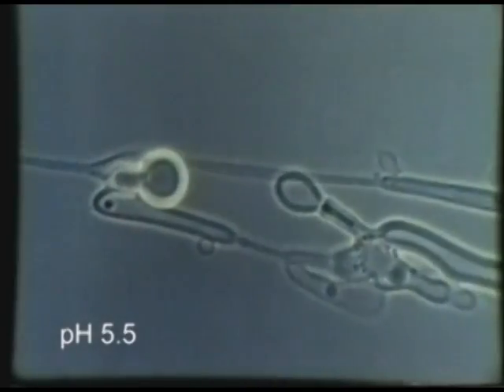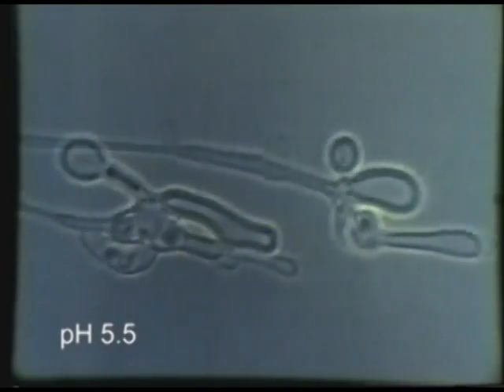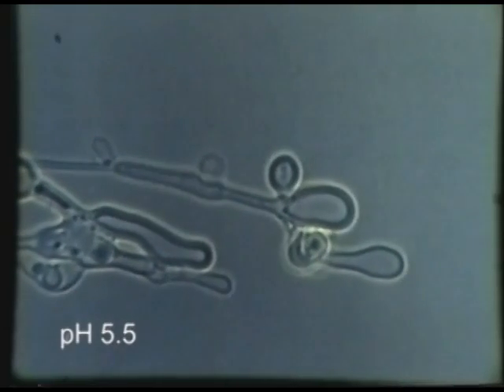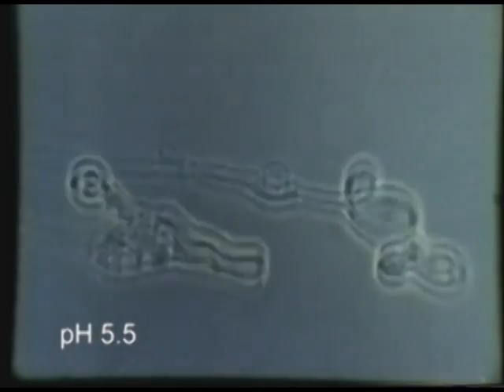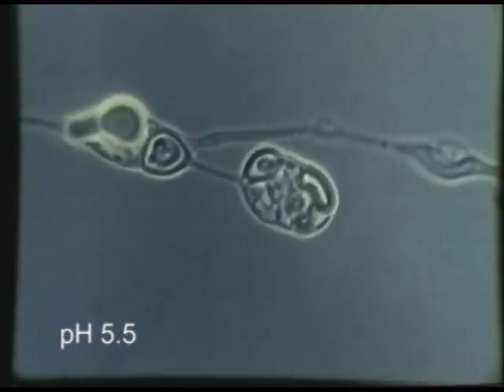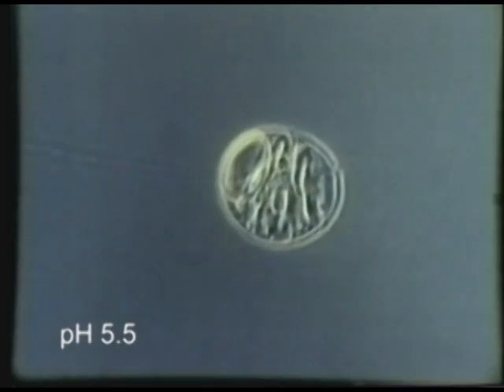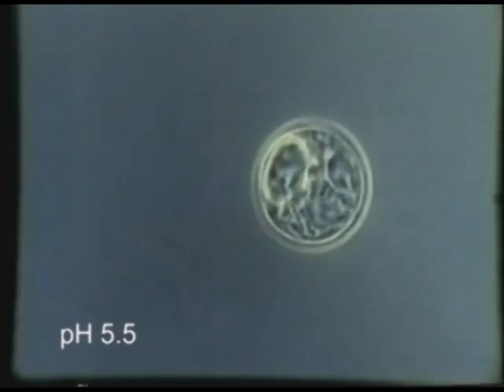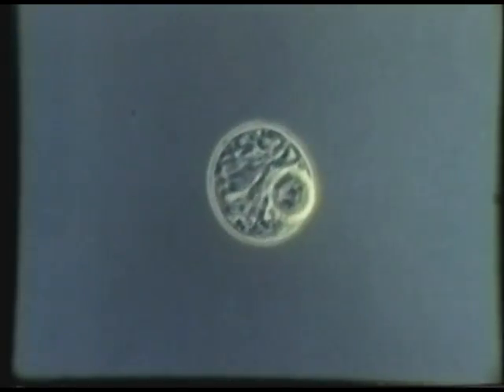Myelin figures formed from lipolytic products are rapidly transformed to lipid droplets when perfused at pH 5.5 with tris-maleate solution. The myelin figures are quickly retracted to sites of origin as acid soaps in the bilayers become protonated and form lipid droplets between leaflets of the bilayers. The return of fatty acids to sites of lipolysis demonstrates that the leaflets of bilayers of myelin figures are continuous with the lipid monolayer surrounding triacylglycerol.